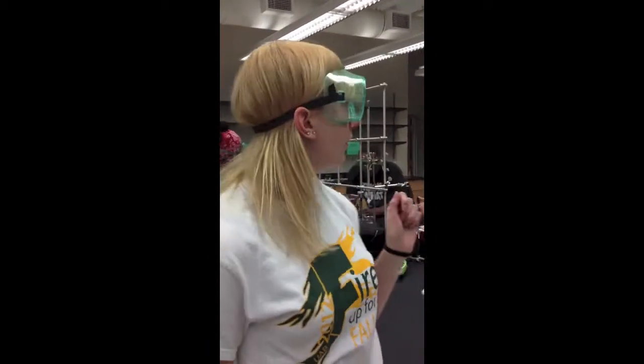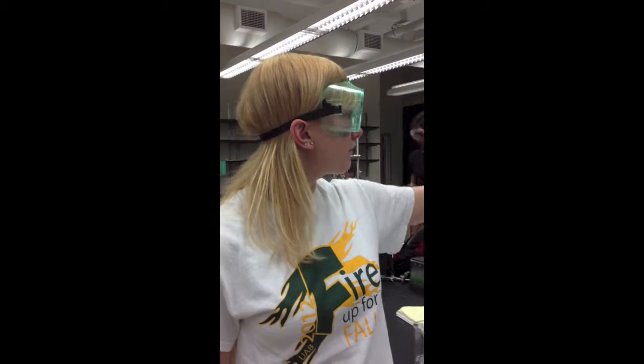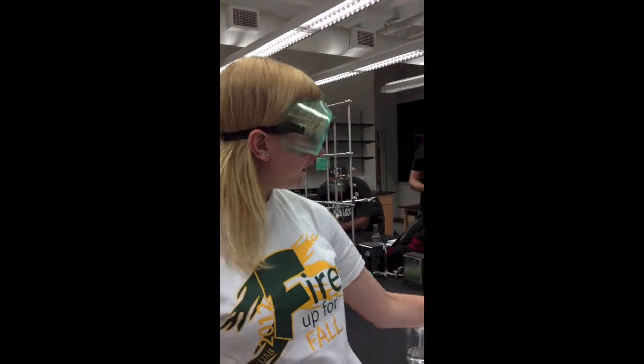And in this burette, we have measured an initial volume of 10 milliliters from the top, or all in all, I have 40 milliliters in this burette. Before we began, we primed this burette by cleansing it with water, and then we also put about 10 milliliters of the NaOH into the burette and swished it around and drained it. We did that 3 times to be sure that the entire burette was primed properly.